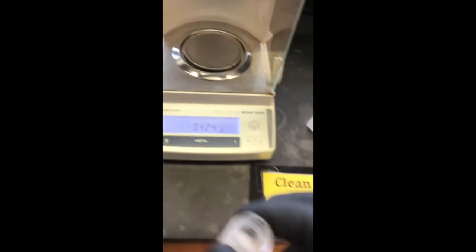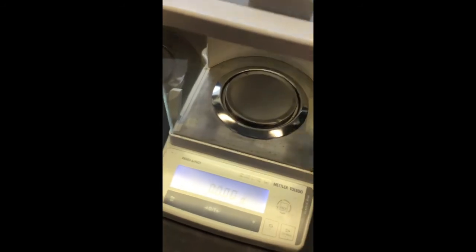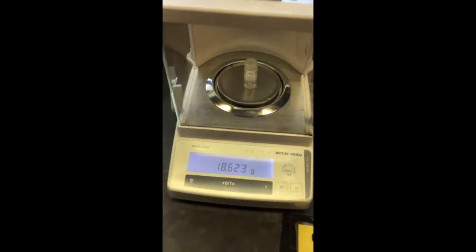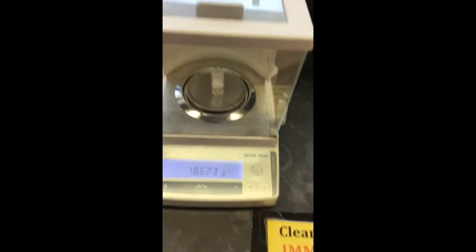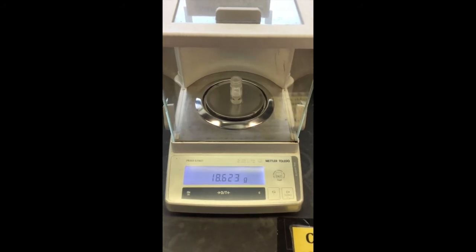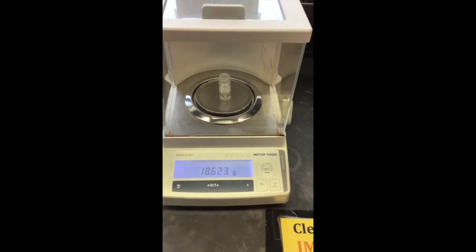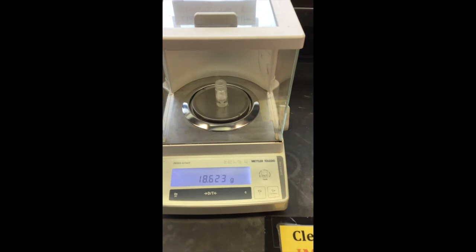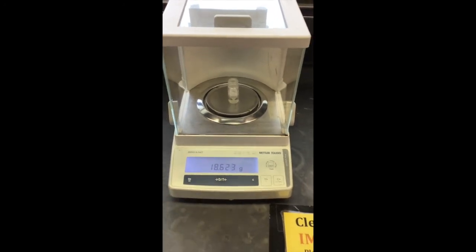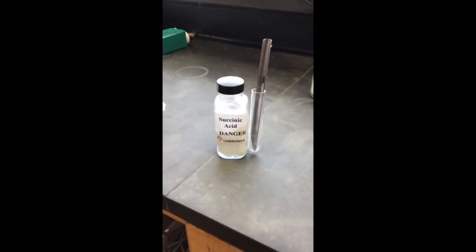Now look at all that solid! Let's check it out. Zero the scale, place the vial with all the benzoic acid on it — that's 18.623 grams for the vial plus benzoic acid. Subtract the mass of the vial to find how much benzoic acid is in there, and then you can do your calculations for the distribution coefficient. For the next portion, I'm going to do succinic acid — I already weighed out 53 milligrams, so go ahead and record that mass.